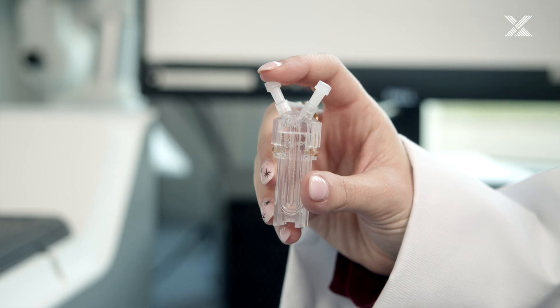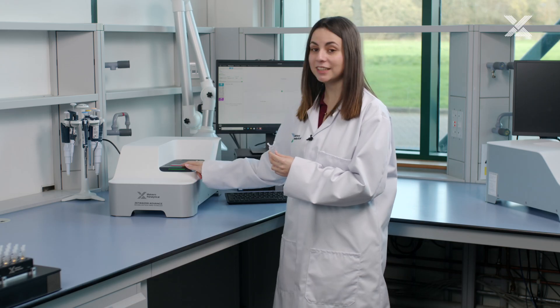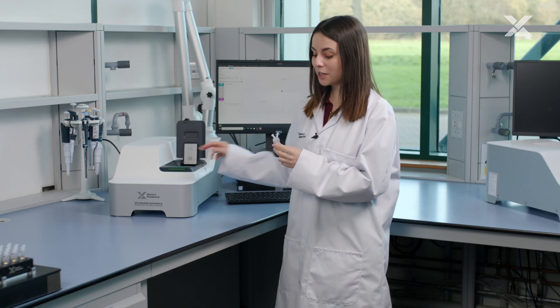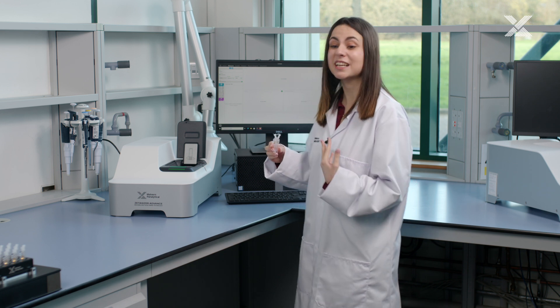First of all we need to have our cell ready with our sample and we need to insert it in the instrument making sure it's in the correct orientation with the logo facing us.